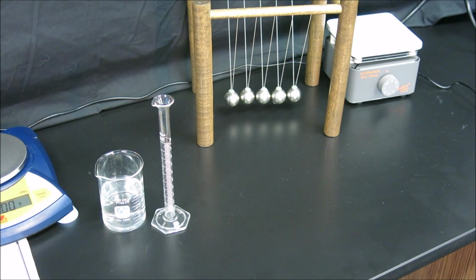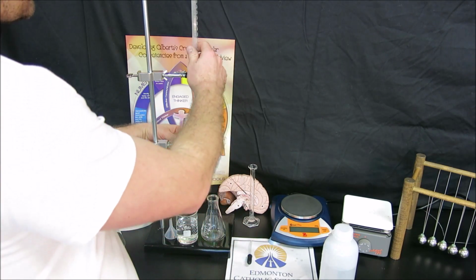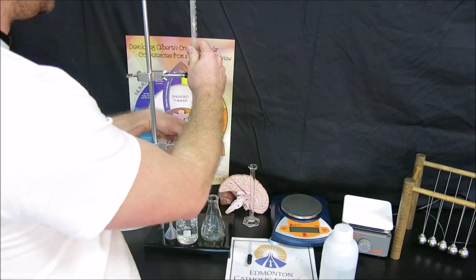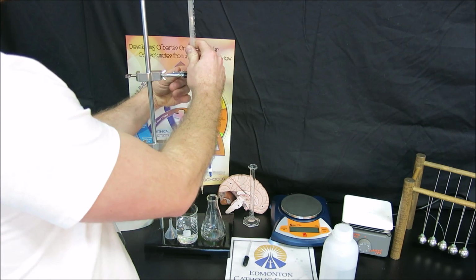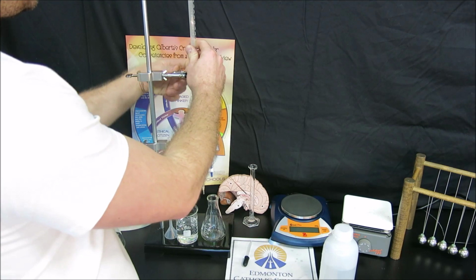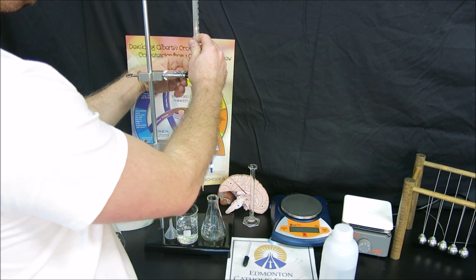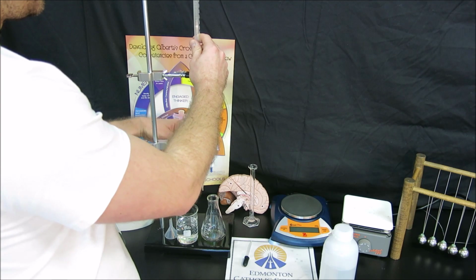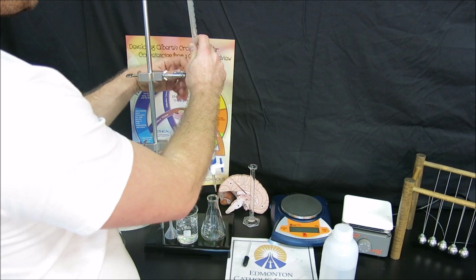We're now ready to go ahead and prepare our burette. Now, titration shouldn't occur until the burette has been rinsed. So we do need to take the burette out of our burette clamps. We need to make sure that it's rinsed. The reason for rinsing is, of course, not knowing who used the burette before or what chemicals possibly were inside the burette. We don't want any contamination with our titration, as this is a very accurate way of measuring a concentration.